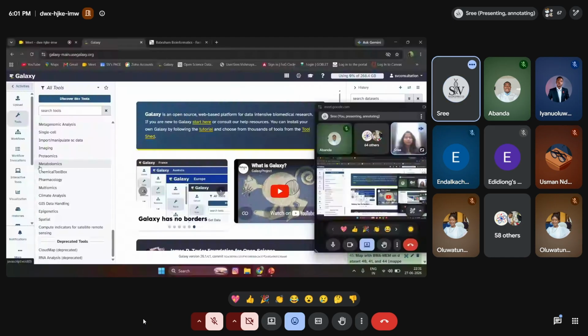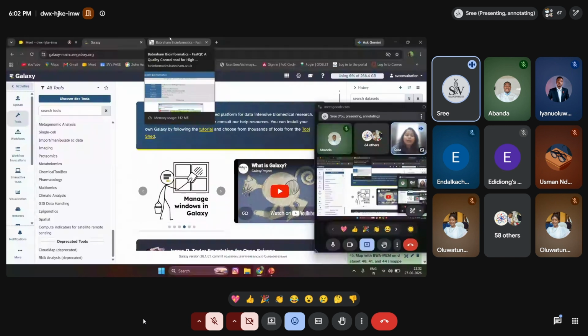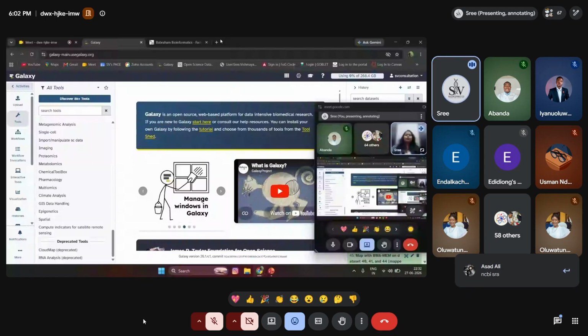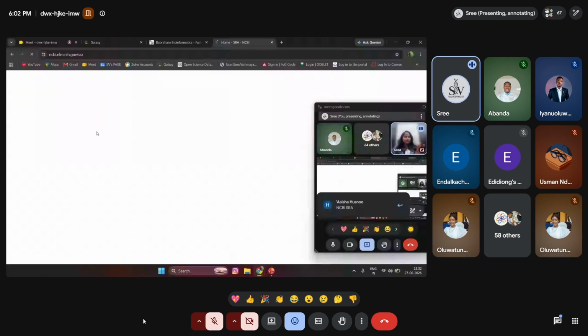The question is, for example, we are going to perform a quality check using a FastQ file. From which source will we get the FastQ file data? We need to go to NCBI SRA. Yes, right. If we go to NCBI SRA, I just want E. coli data.